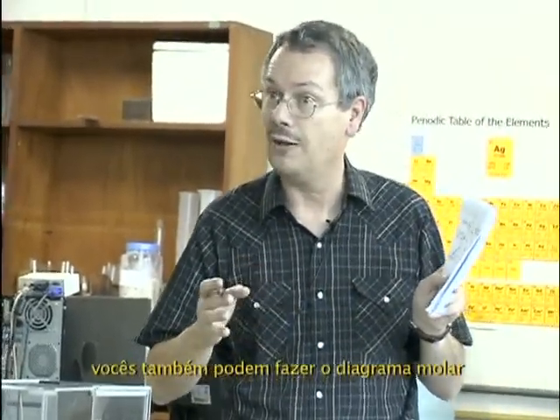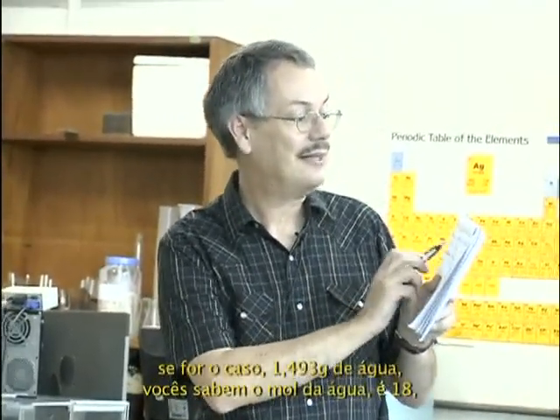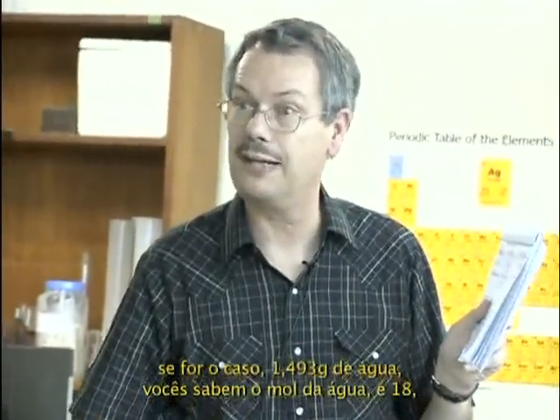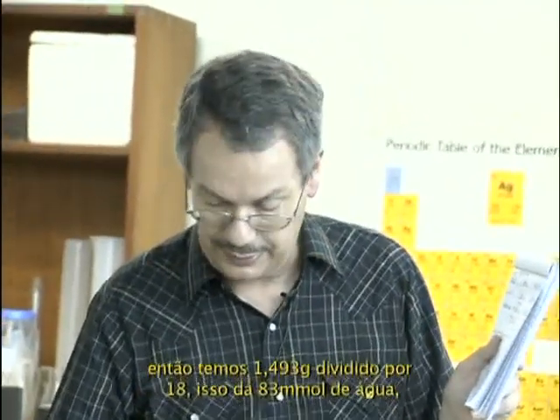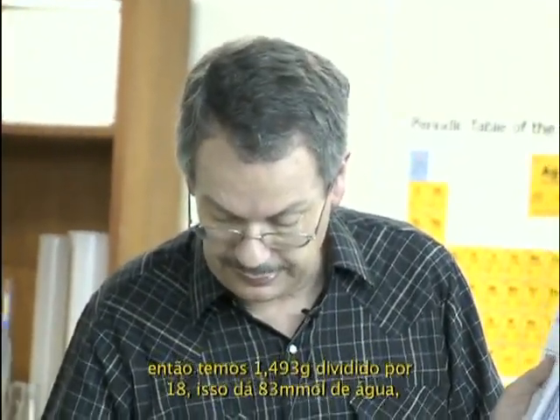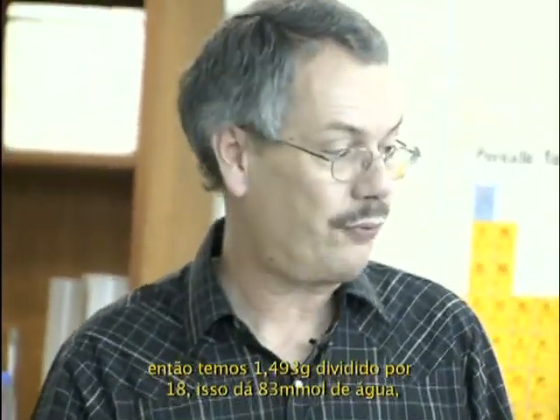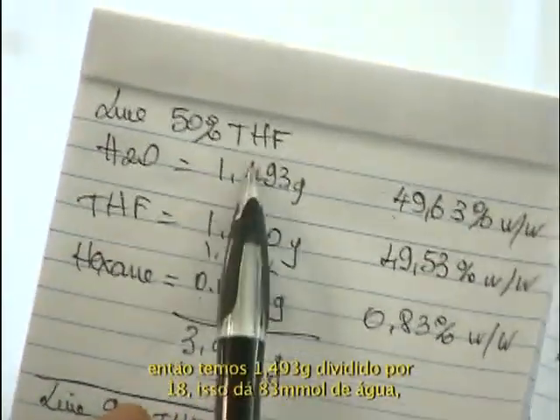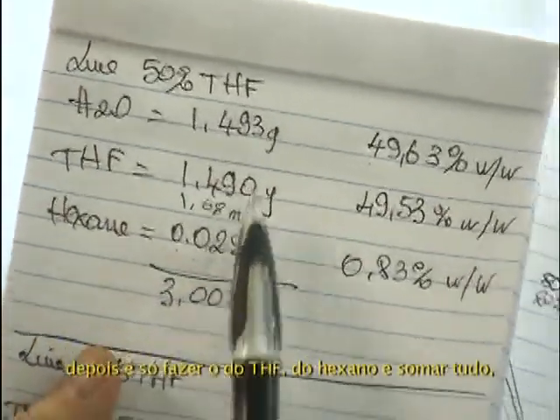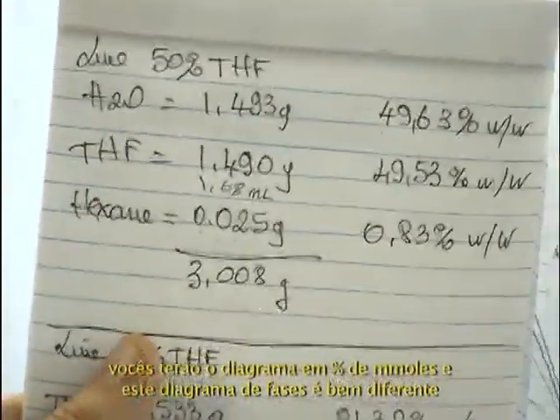If you go to mole, because you can go to mole, I can say 1.493 gram of water. You know that the molar mass of water is 18. It's 1.493 divided by 18. This is 83 millimole of water. And that's a certain amount of millimole of THF and millimole of hexane. I can sum the millimoles and work in percentage, molar percentage.